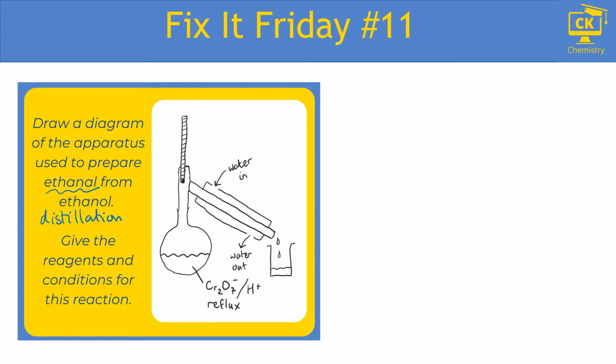Well, we've got a round flask with contents. So that's a strange thing to say maybe. But it's also quite frequent that students will just forget to draw that little line in their flask that actually shows that there is a reaction mixture in there, and they're drawing empty flasks. You can draw a round flask or a pear-shaped flask or some sort of weird thing that's halfway in between if you're not very good at drawing. We don't want to draw a conical flask because we're meant to be distributing the heat. So the flask with contents is good.